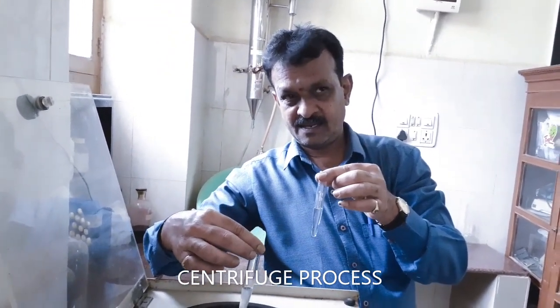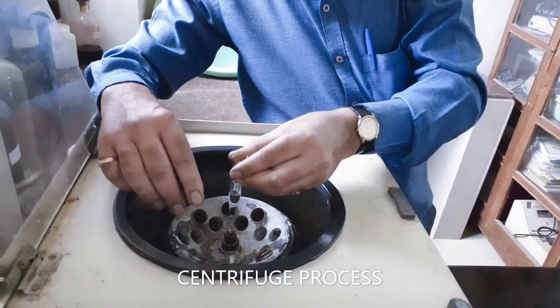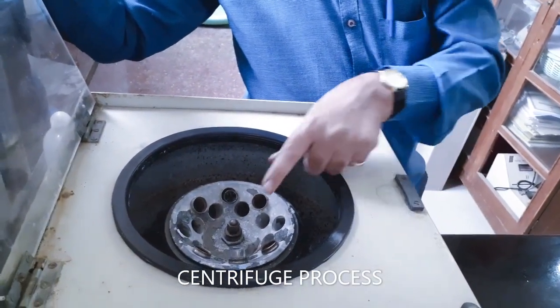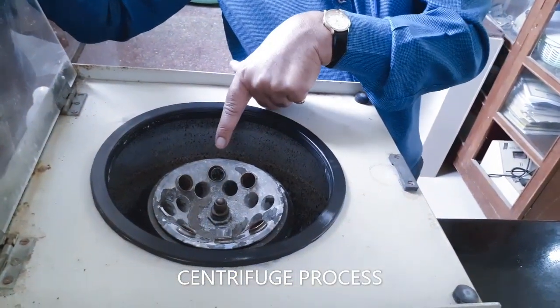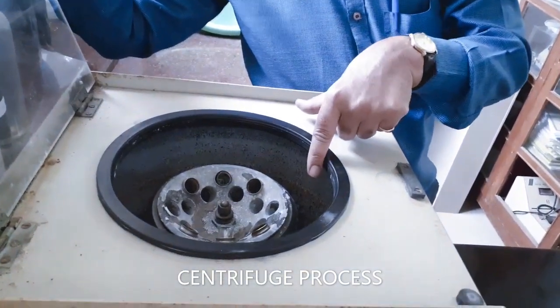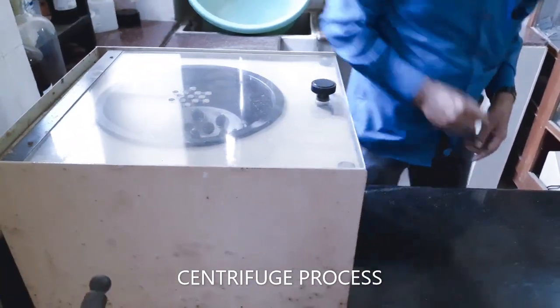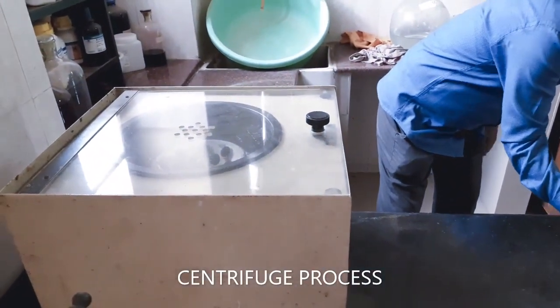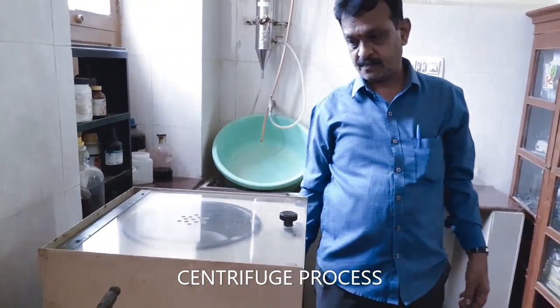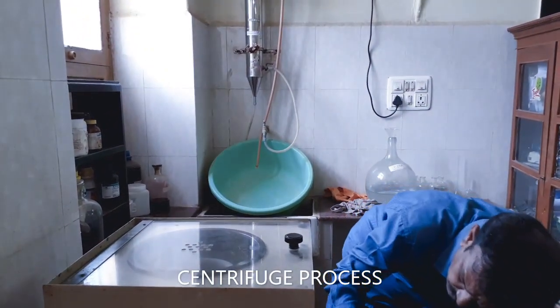Now our laboratory assistant Mr. Ganesh is keeping the centrifuge tube into the centrifuge machine. One test tube containing precipitate in one direction, another centrifuge tube containing water in the opposite direction. Now he is closing the centrifuge machine lid and starting the centrifuge. So now the centrifuge machine is working.